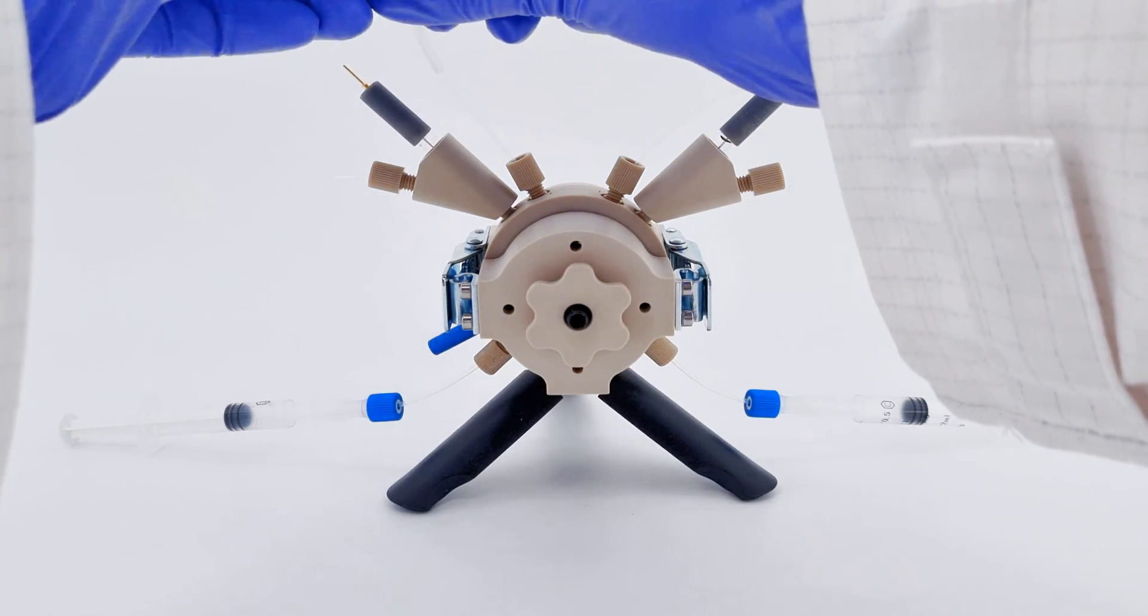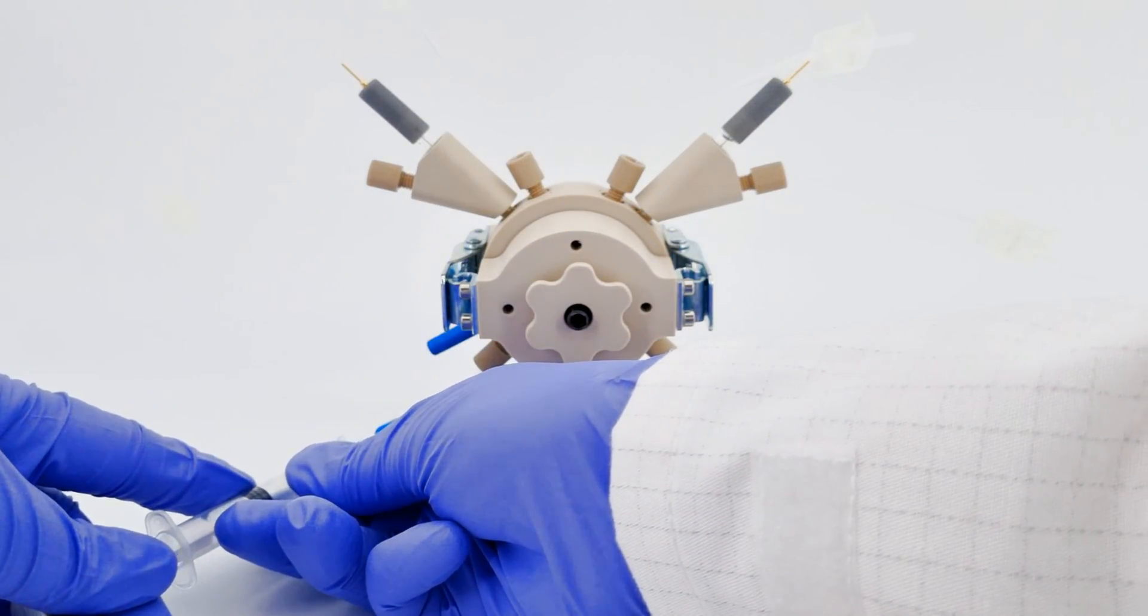Now, let's disassemble. Begin by unclamping the clip on the reference electrode tubing. Withdraw a modest amount of liquid.